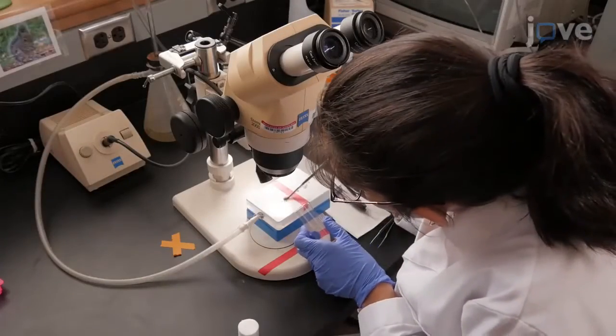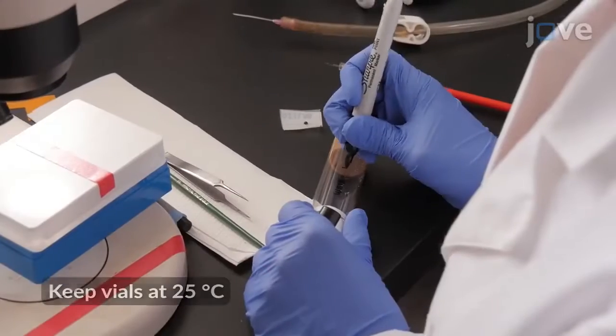Transfer each fly into the appropriate vial as it is injected, noting the time on the vial.